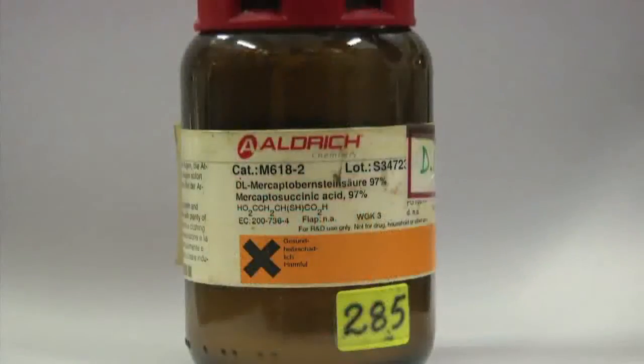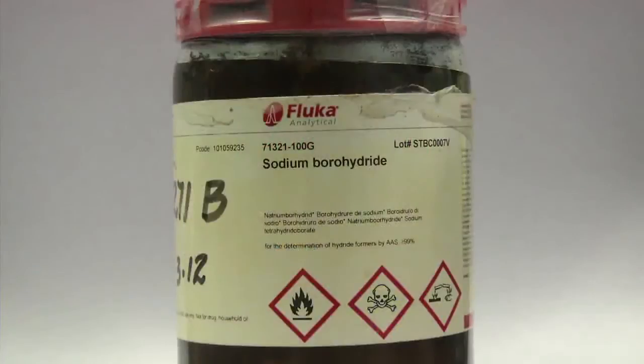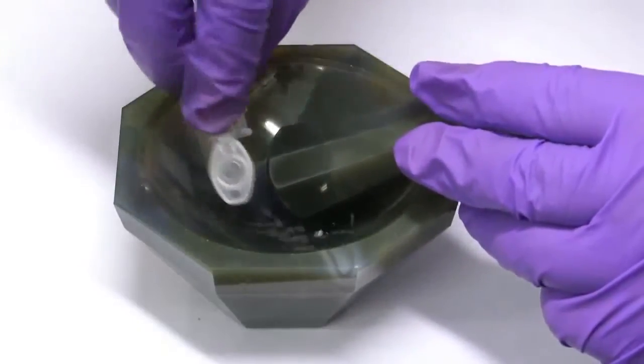There are various ingredients used for the synthesis. First, silver nitrate crystals are taken in a mortar.